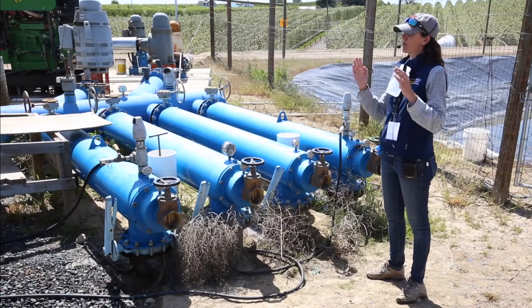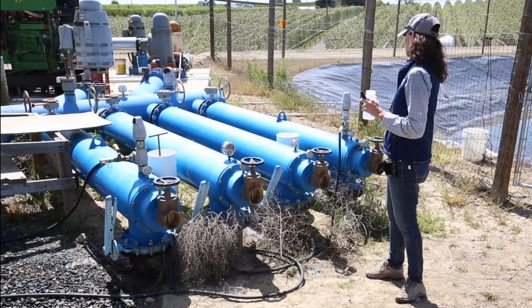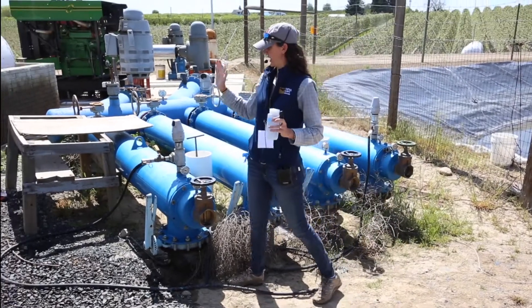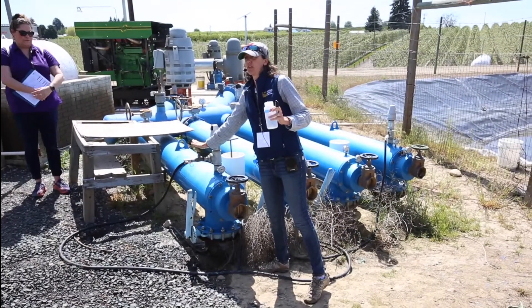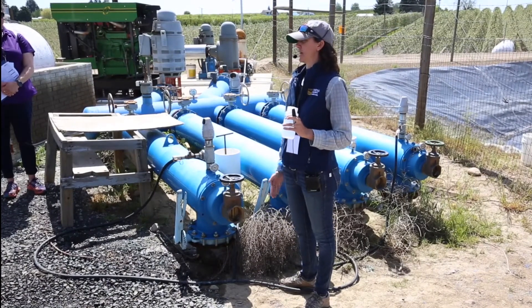If you need to use a hose, bring a little section of hose that's your hose — your clean sampling hose that you store in a nice dry place — and replace it when you come out here. Alternatively, find another sampling location like this one right here that doesn't have a hose attached. You can see the splash pattern; it's coming at you.